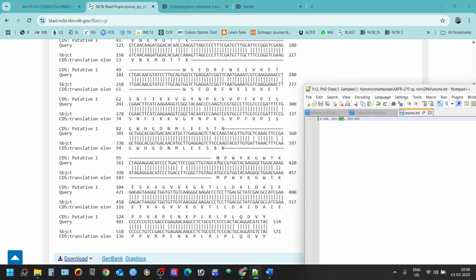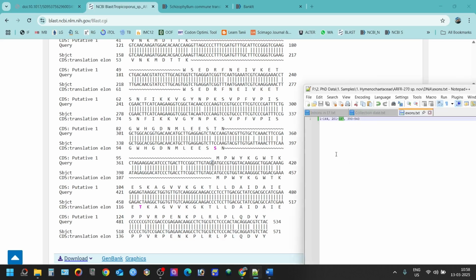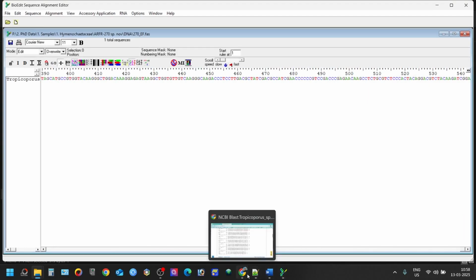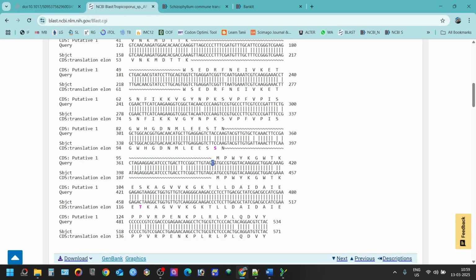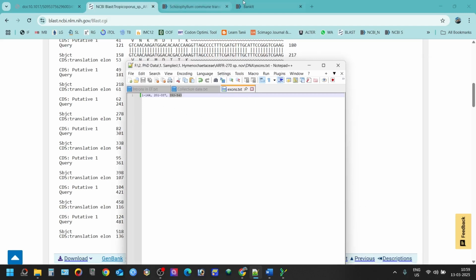In the same case, we can do the same thing from here. And I've already counted that from here to your last sequence, that is 543. It's not mentioned here. You have to go to your sequence to see the last sequence. For example, you can see my last sequence is 540, 1, 2, 3. But here it is only mentioned 534 because it is aligning up to 534, and after that maybe they don't have the sequence. Maybe the sequences are not available for this query sequence, so they have interrupted it here. But the end of your sequence, for example our sequence, is 543. So from this sequence to the end, that is 543 we have, and this region is 393 to 543. So now that we have all the exons, we can put them here.